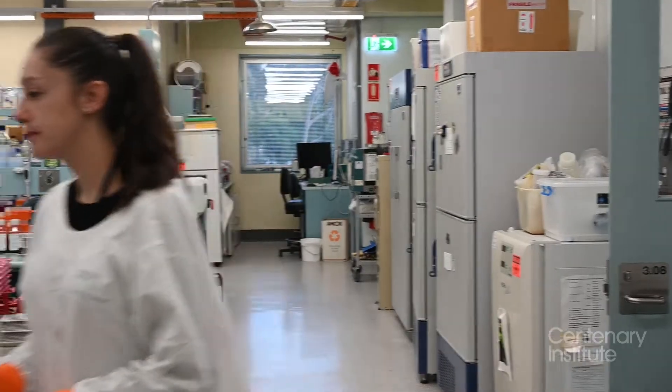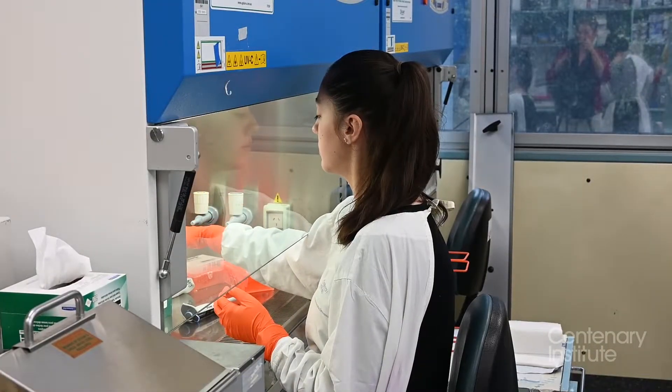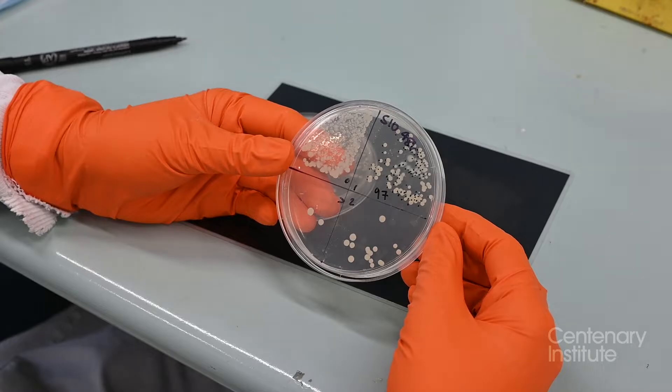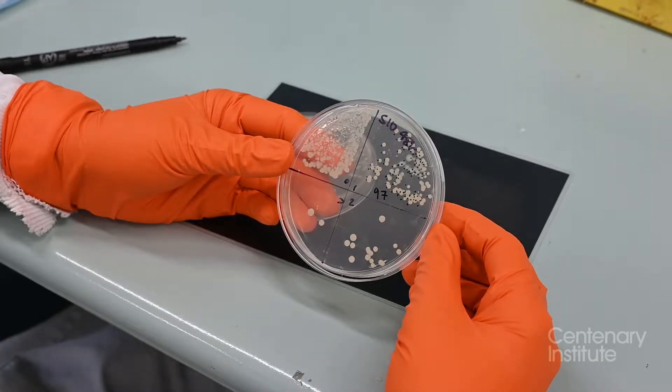In this experiment I'm testing the effectiveness of different drugs in fighting bacteria. I'm using cells from our immune system called macrophages.